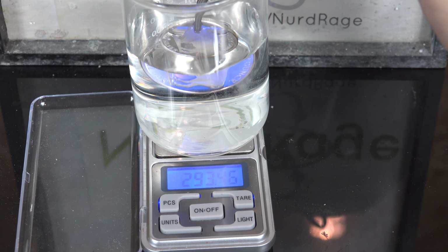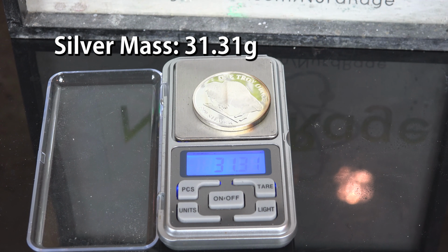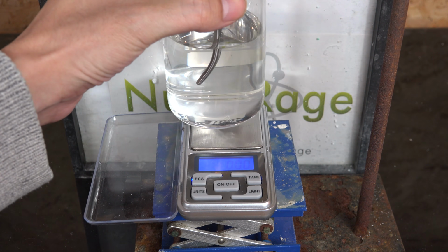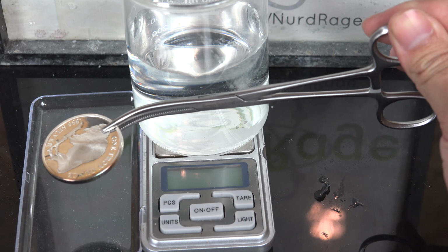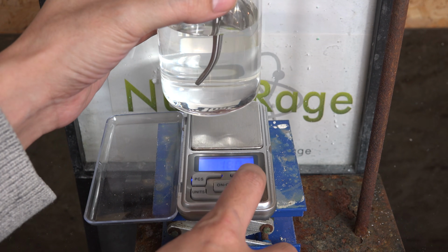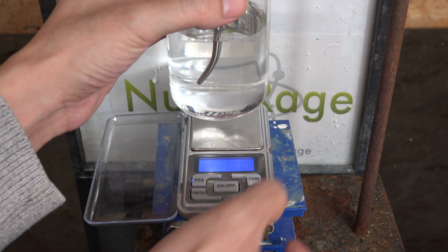So let's do that. First, we weigh the solid itself. In this case, I'm going to measure this silver round. Now to measure the volume, we need to submerge it in a liquid of known density, and I'll be using the obvious choice of deionized water. The displacement of water will tell us the volume. I'm going to hold the solid using these forceps, but the problem is the forceps themselves will displace a little water too. So to calibrate it, I dip the forceps down to the depth I think I'll be holding the silver round.